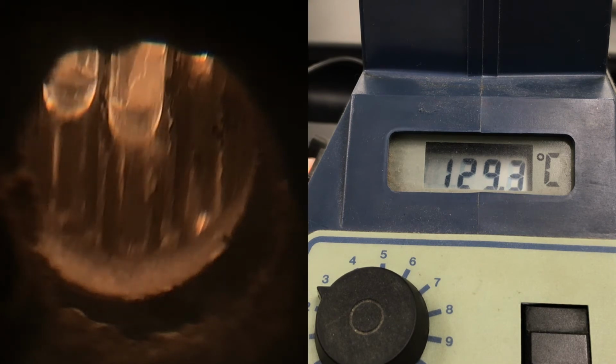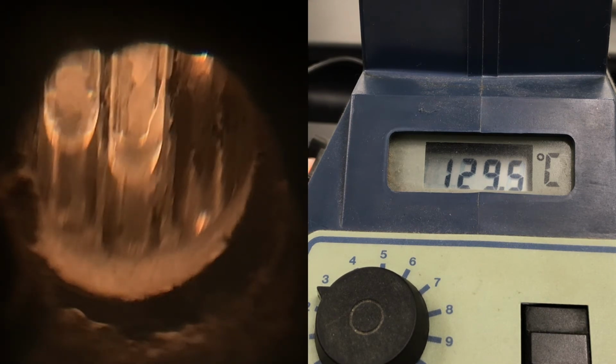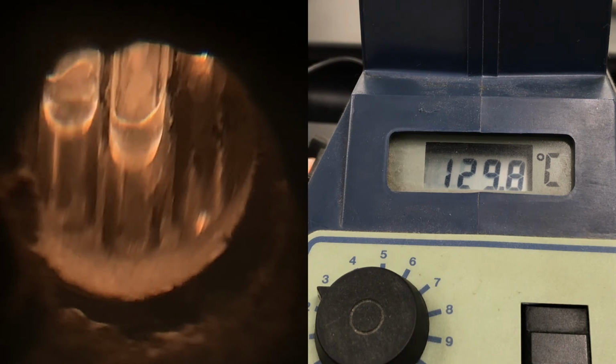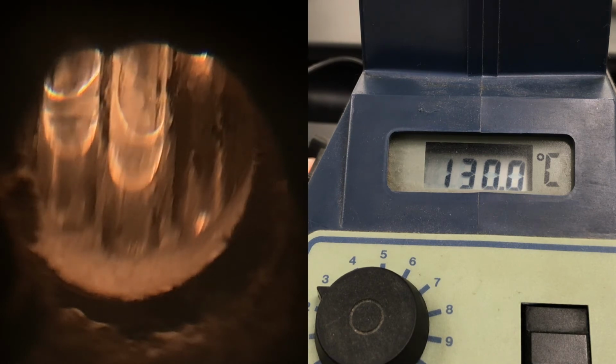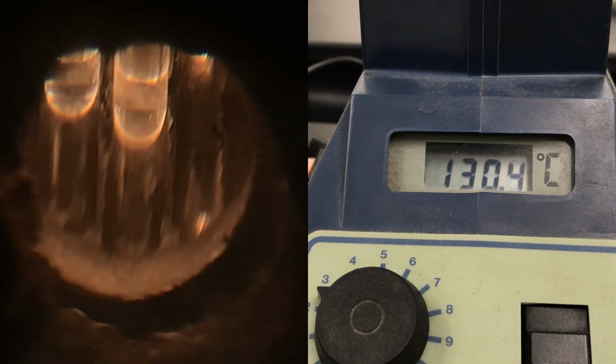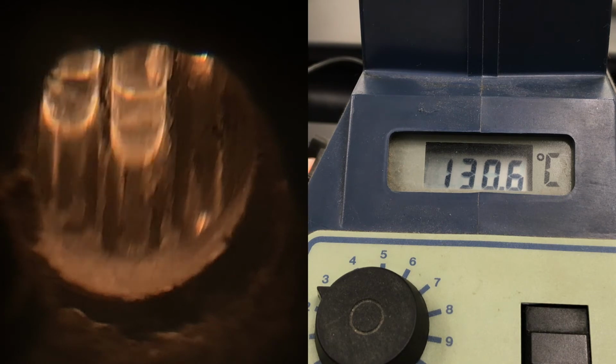Want to look for something that looks like melting snow, and remember that the final temperature that you should record is when it looks fairly homogeneous and looks like water.